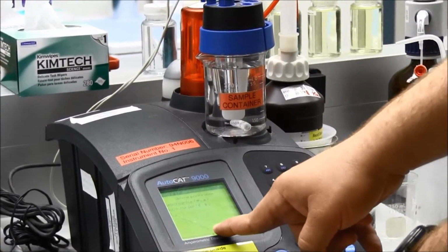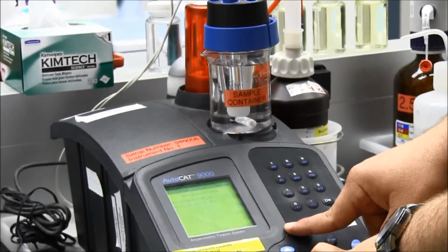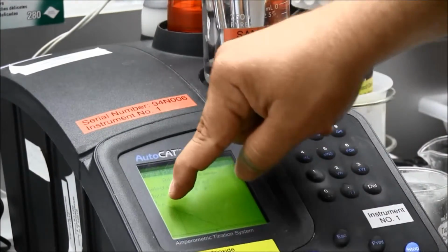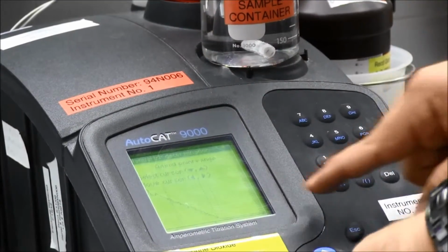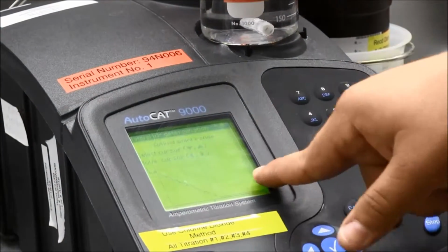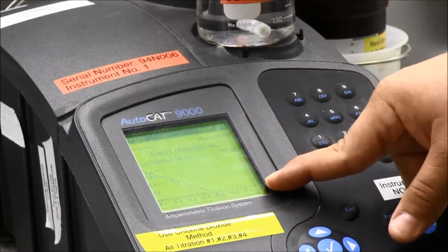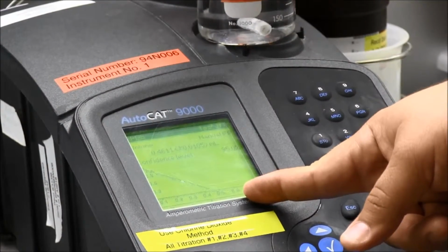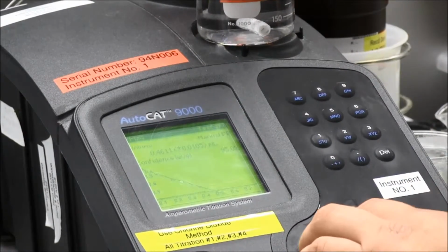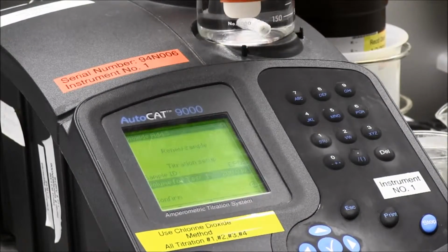My second cursor, I'm going to go just before the endpoint. And the first cursor, I'm going to move it up a little bit, because I have nice data points right in there, before I get to this top where there's a little bit of noise. So I have all the cursors set. I'm going to hit OK. I have a nice straight line on the bottom, nice endpoint with it hitting down there at the bottom. So I'm going to hit OK to accept that. And now at this point, this sample right here is done.